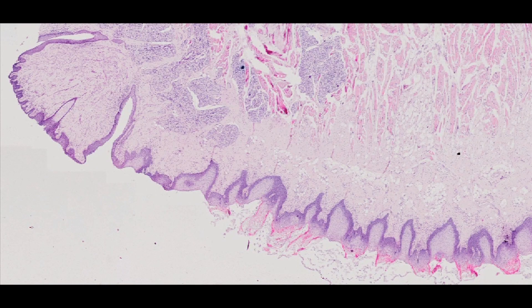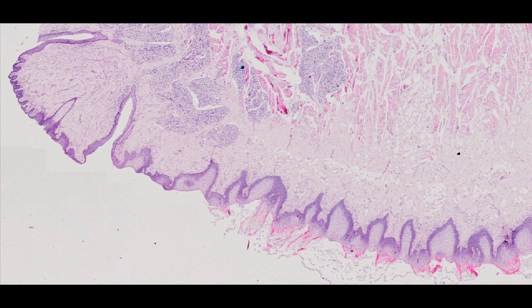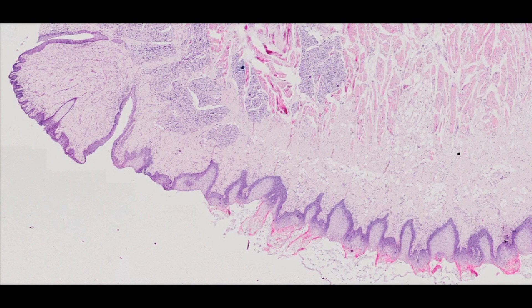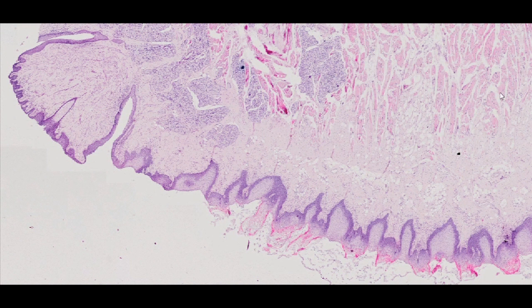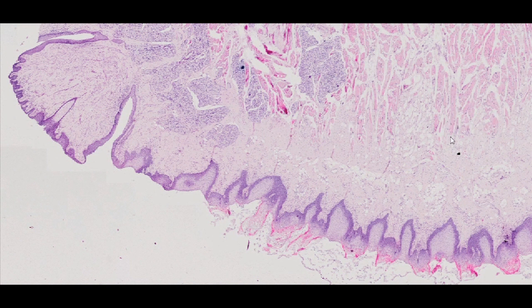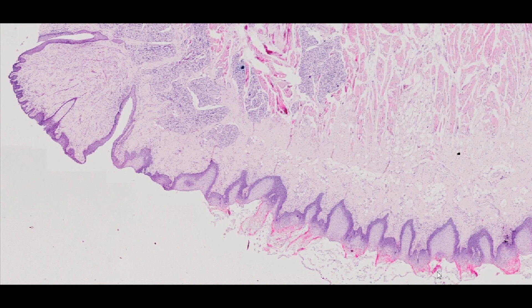The tongue with filiform and circumvallate papillae, H&E staining. The specimen is a cross-section of the tongue stained with the standard hematoxylin-eosin method. The tongue is an organ that forms part of the floor of the oral cavity. It is made of bundles of striated muscle fibers that run in three planes, crossing each other typically at right angles, enveloped by fascia and mucosa.